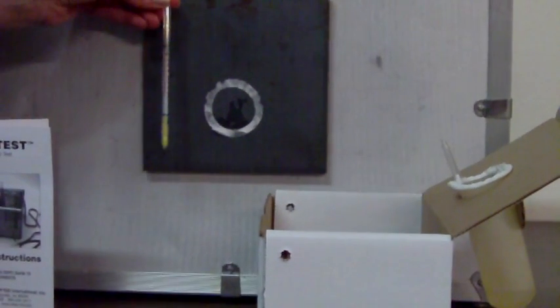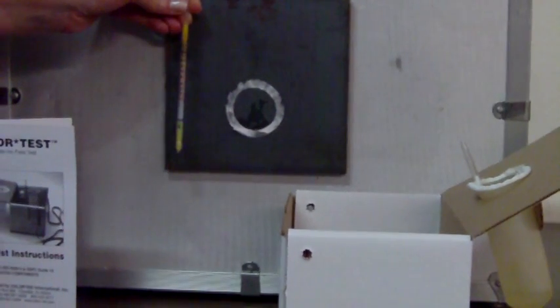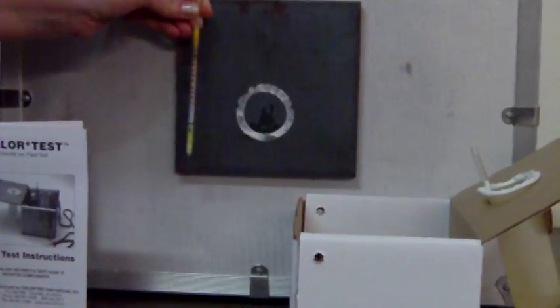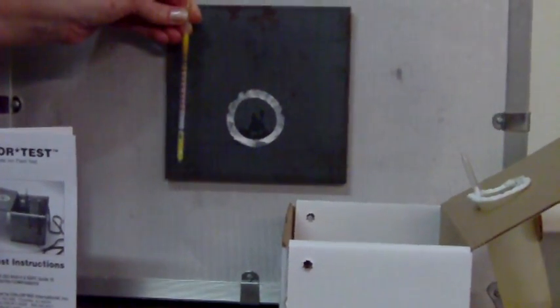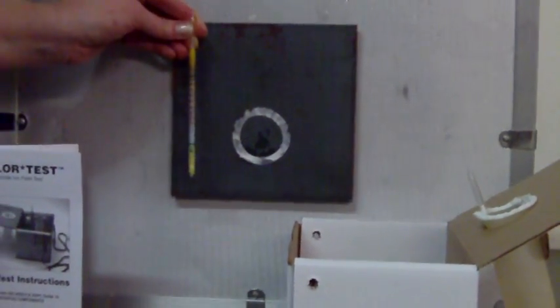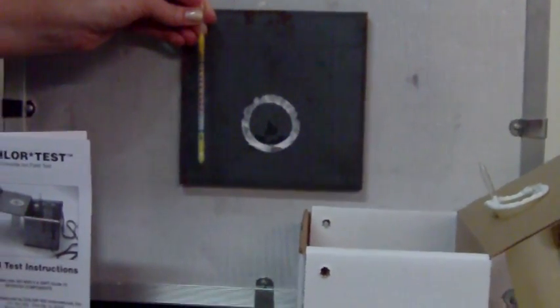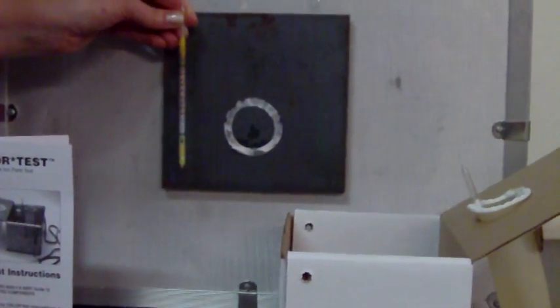The tube measures in parts per million, and we have engineered the test kit so the parts per million is a one-to-one ratio to micrograms per square centimeter. So if you've got five parts per million, you've got five micrograms per square centimeter. We've pre-done all the math. There's no calculation to do.